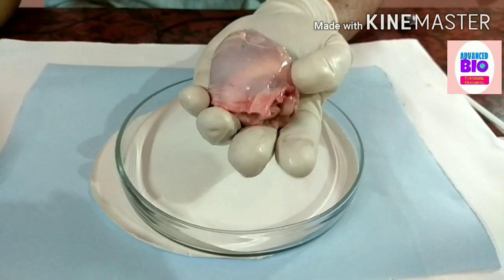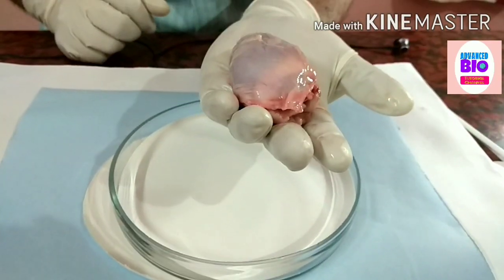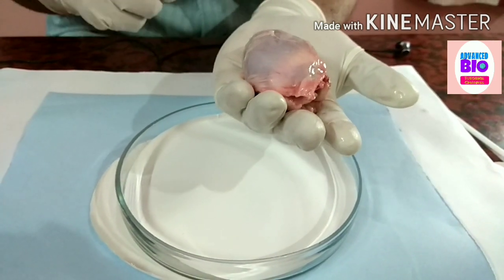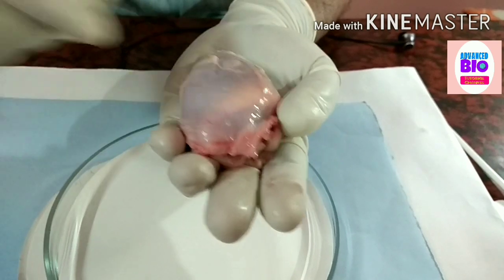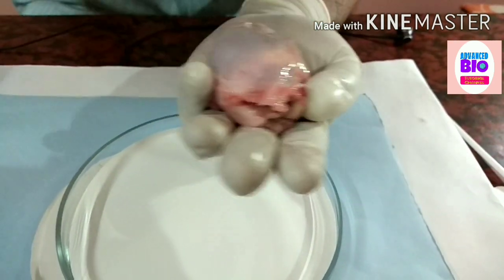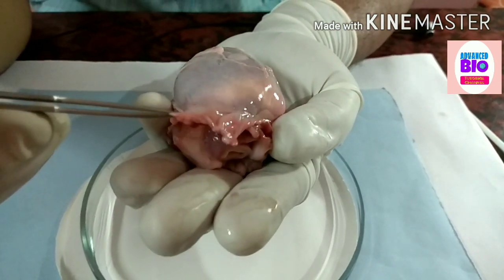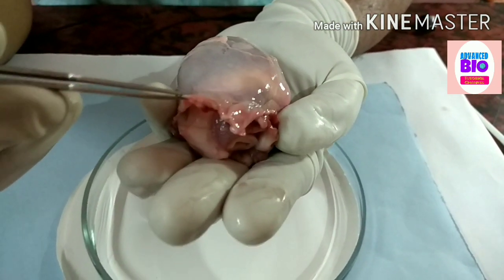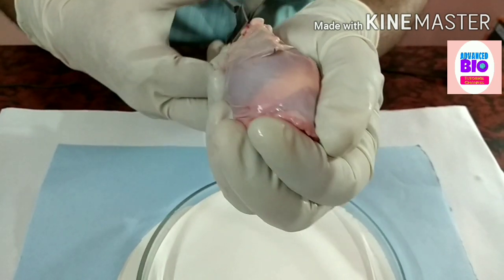No more talk — let's start. Now see the heart. We know the heart is surrounded by a thin membrane. This membrane is known as the pericardium. I have to rupture this pericardium first.